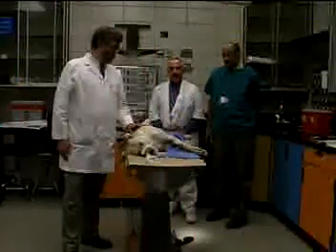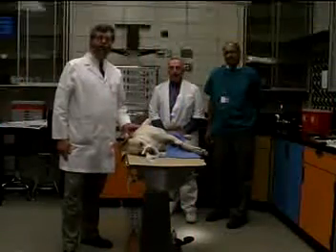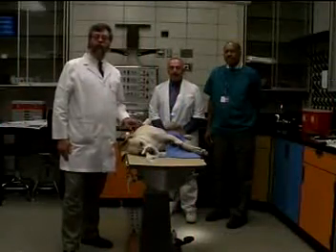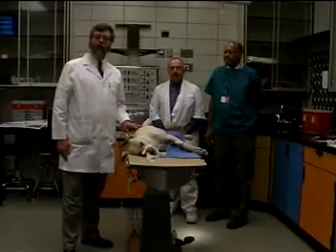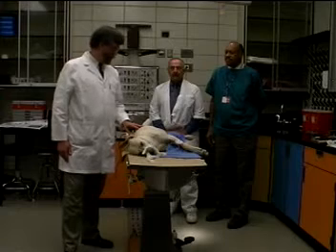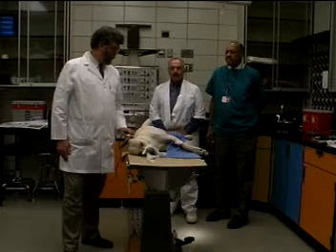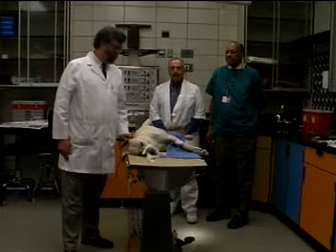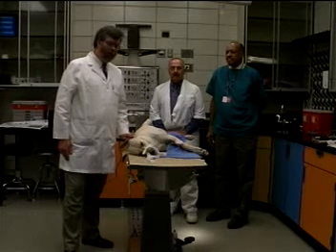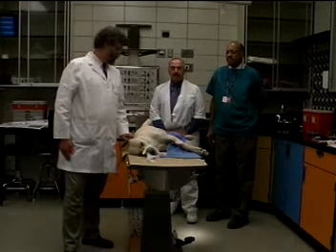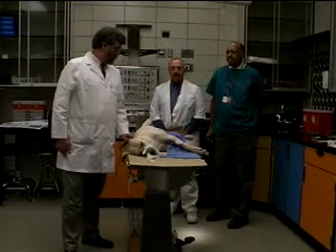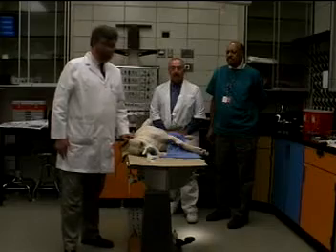This laboratory is designed to demonstrate the effects of drugs acting in the autonomic nervous system. We have a 23 kilogram mixed breed bitch.